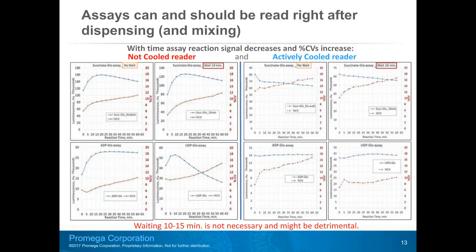In all graphs, luminescence data behave as we discussed earlier. For the not cooled reader, we observe signal increase associated with reaction temperature increase and luminescence increase, as absent for the data obtained on the T-cool reader. But percent CV, or coefficient of signal variation, brown dash curves, is increasing with time in all the graphs. This signal variation increase combined with the overall signal decrease can significantly negatively affect assay Z prime values.